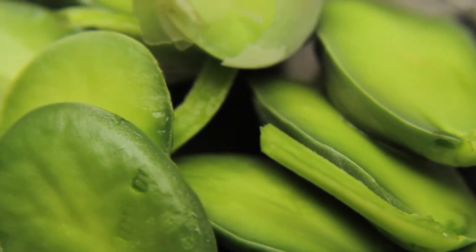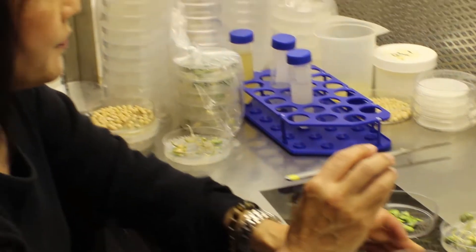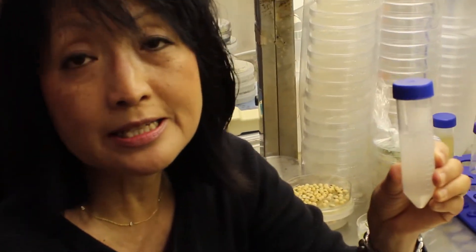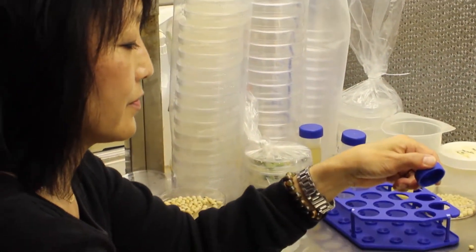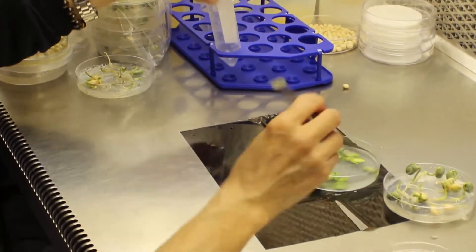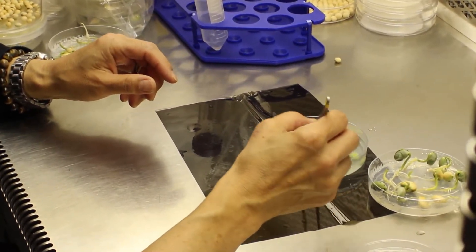Now I'm going to make seven to twelve horizontal slices. Here I have a bunch of wounded cotyledons, and here's the agrobacteria that has been resuspended in our co-culture media. I'm going to pour it over the cotyledons and allow them to sit for about thirty minutes.